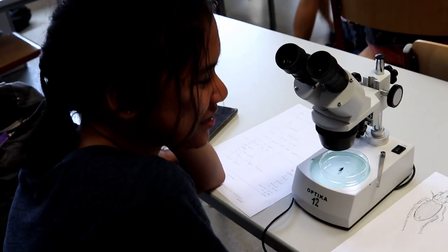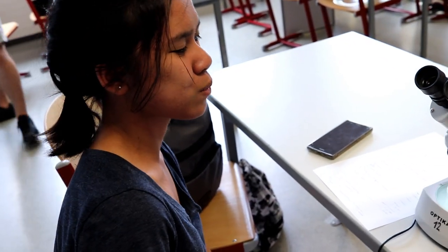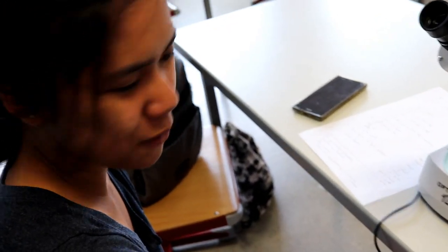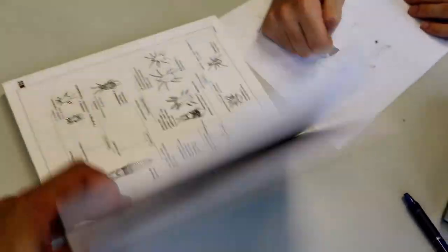Can you tell me what you've been doing today? We've been identifying different insects and right now we're just trying to draw them. And what did you identify? It's a type of beetle — I can never pronounce it in Latin, I'm so sorry. And this is the identification book that we're using — it's in German.